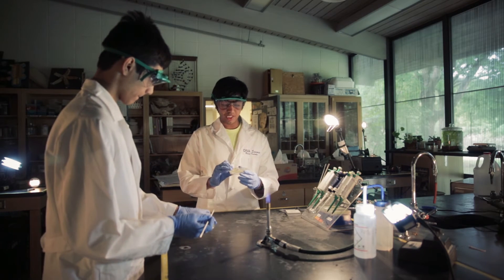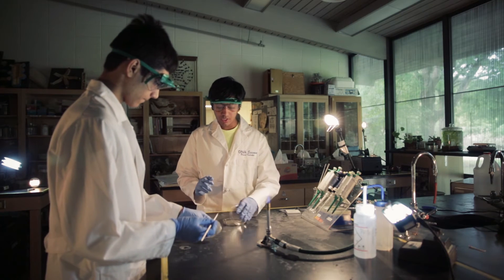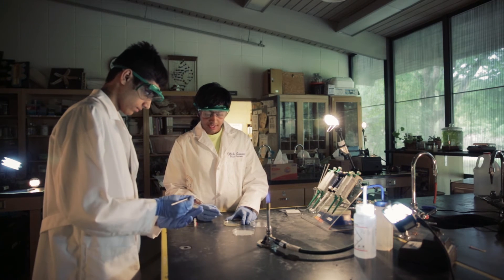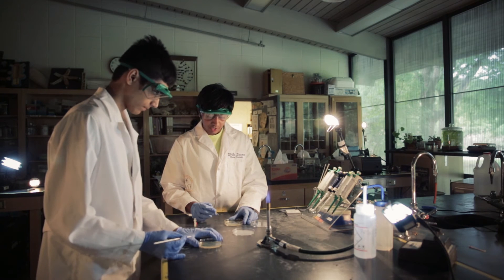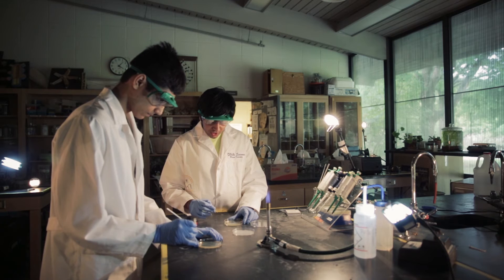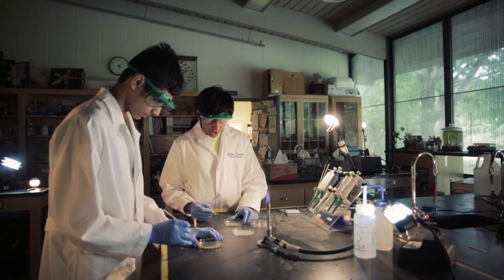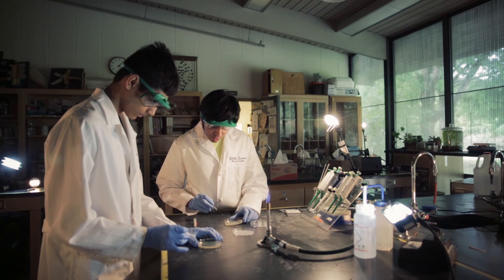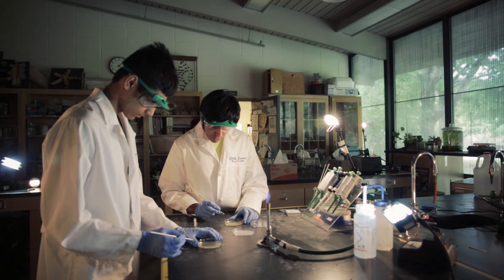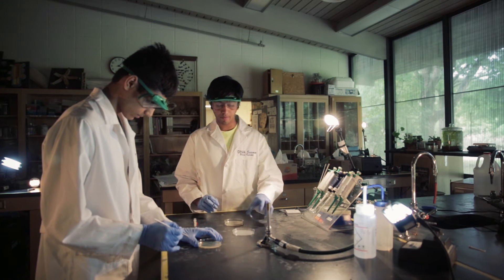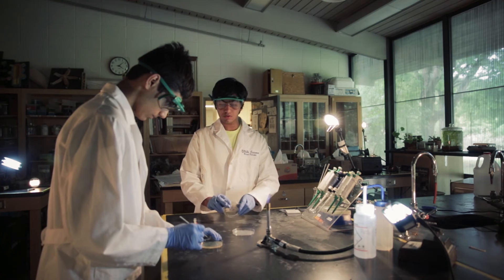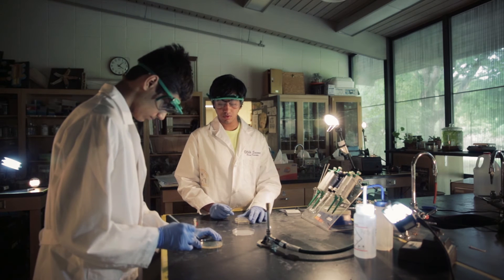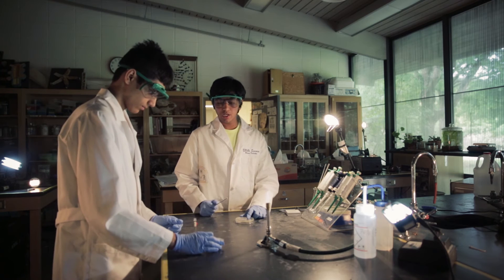And now these plates are always placed upside down. So what we do is we flip it over and open it up. And we're going to slowly—these are sharp. So what we have to do, we have to spread it in a zigzag motion. And in that zigzag motion just gently. And try not to make any scratch marks over the agar, but make sure you get the bacteria on it. And in a slow zigzag motion. When you're done, you cover it up again and flip it back over.